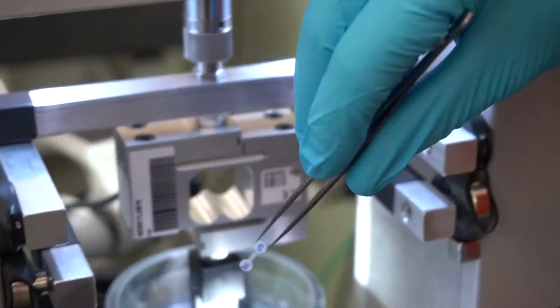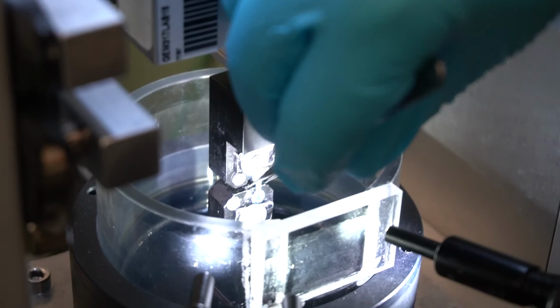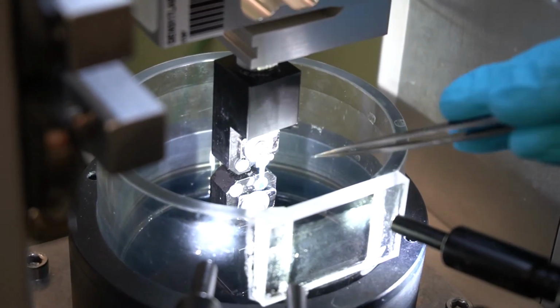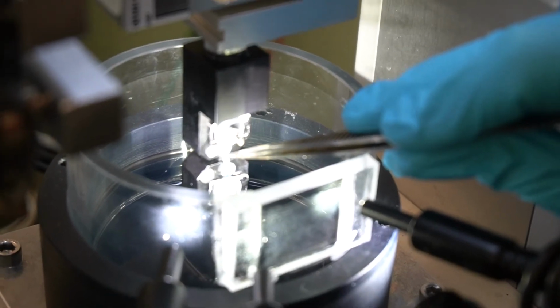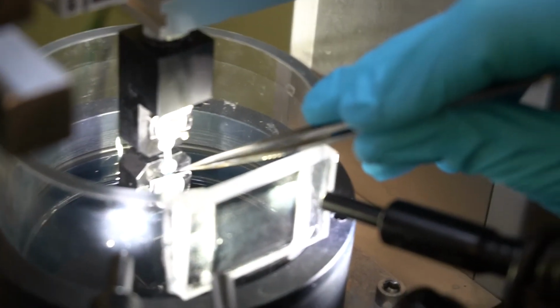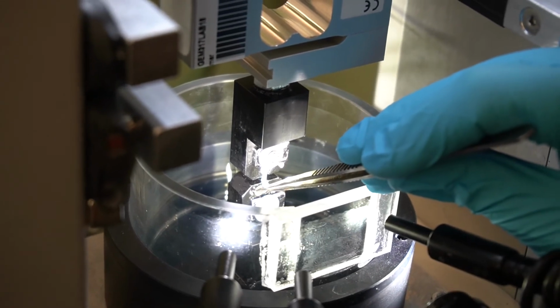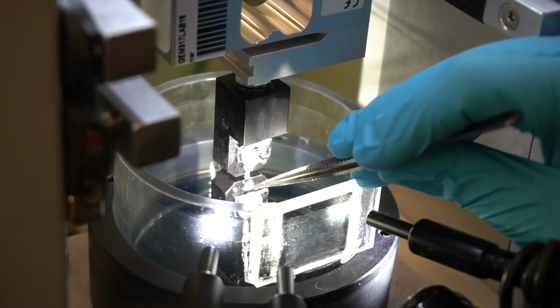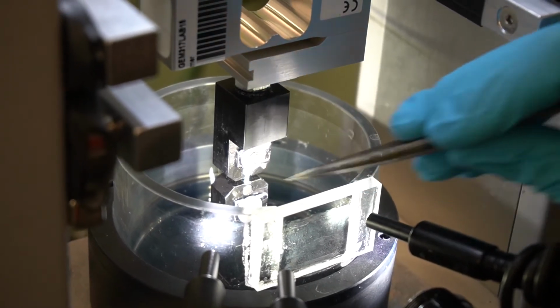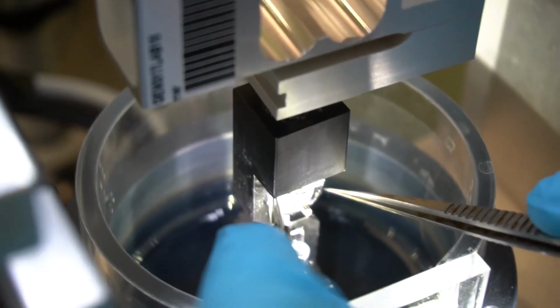Okay, so I take now the sample and I place it here, and now I align it into the sample holder on the bottom and on the top. Now I can add the spacer to apply moderate pressure then with the clamps to have the sample in place. Clamp the sample.